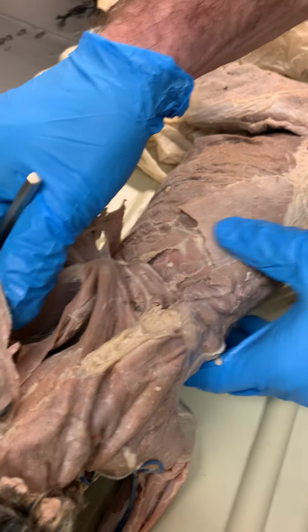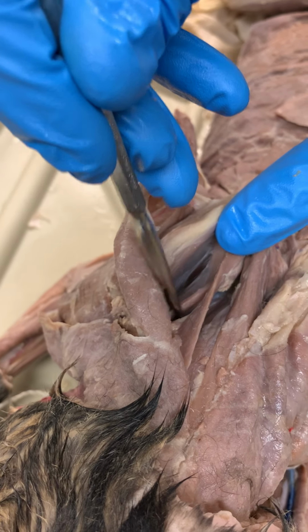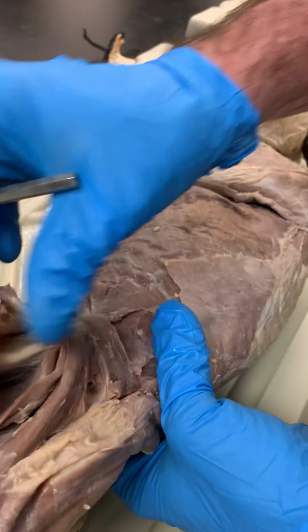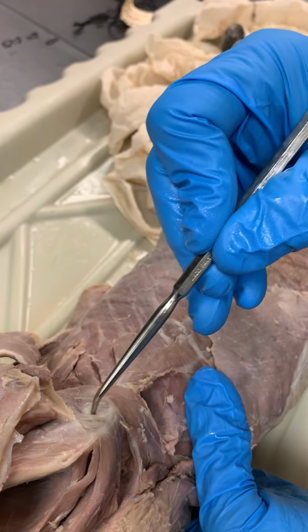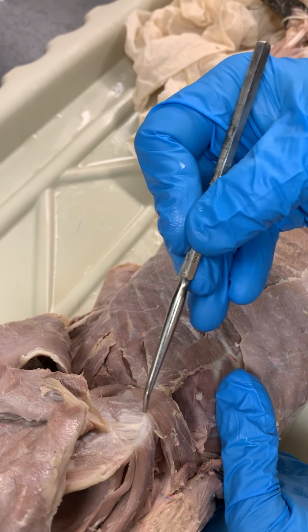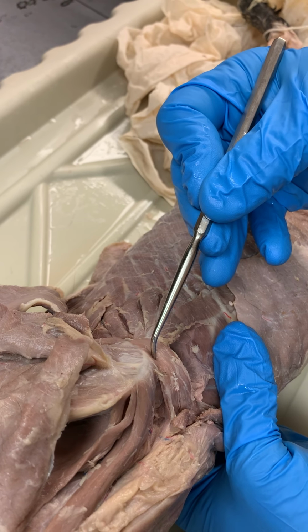Coming back up here on the scapula, we can see our underside is our subscapularis again, and there's this thin muscle here, same one we saw in the deep chest, levator scapulae dorsalis, or simply levator scapulae. On the scapula itself, with your deep dissections, you're able to see, here's our spine, so above it, supraspinatus, below it, infraspinatus, and then right on the margin here again, teres major. You may confuse teres major and rhomboideus major on a tight image, but you let the spine of the scapula be your guide there. You see the spine will be closer to the rhomboideus major.